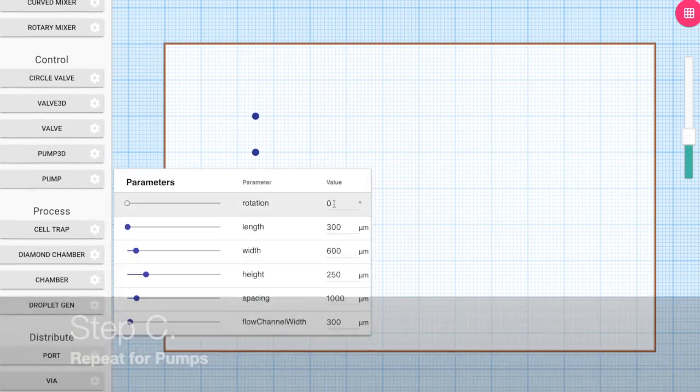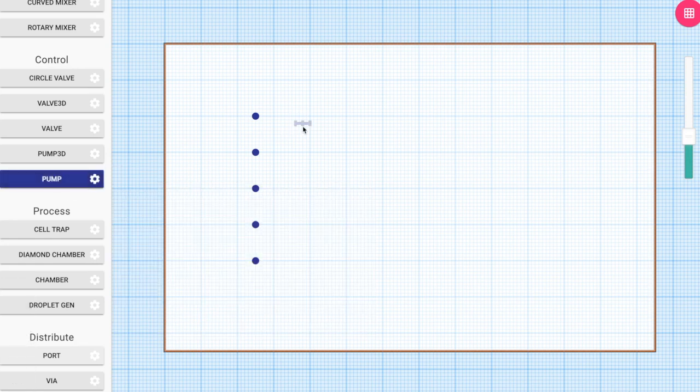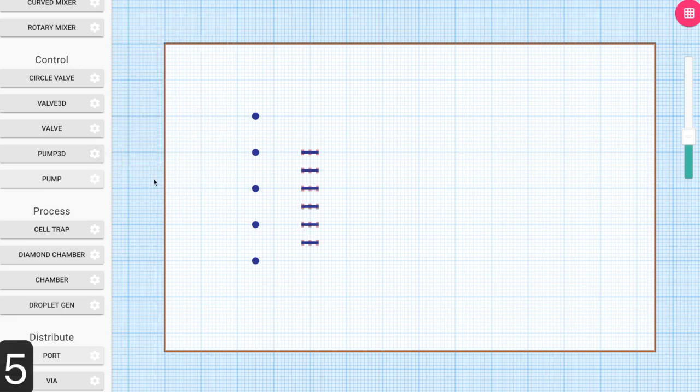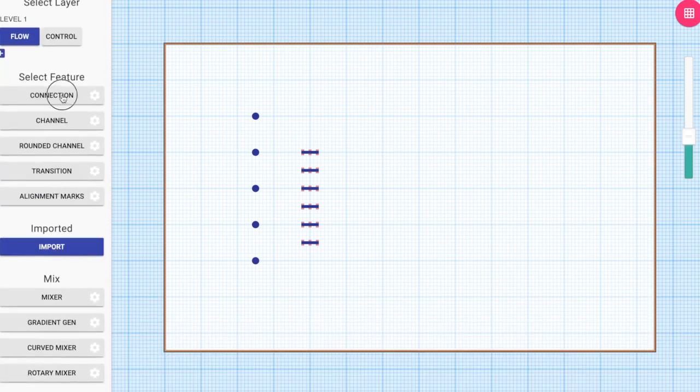We then create a pump, which is part of our design. And we place the pumps on the canvas. And we replicate the same thing by using the generate array tool once again. Because it's a demonstration, I already calculated what the distances between the placements would be. In practice, you might want to play around with this a little more.